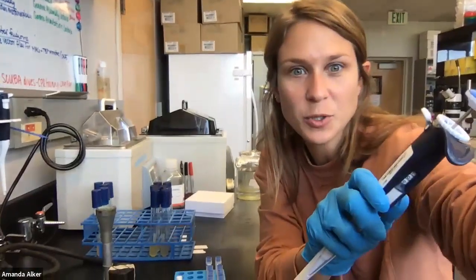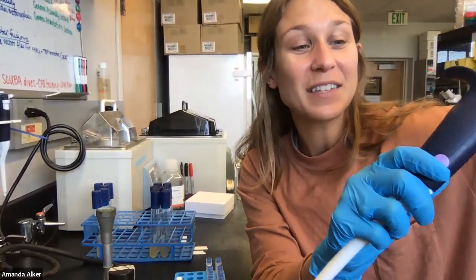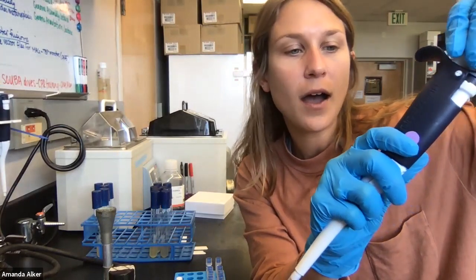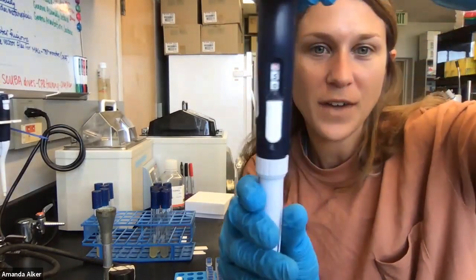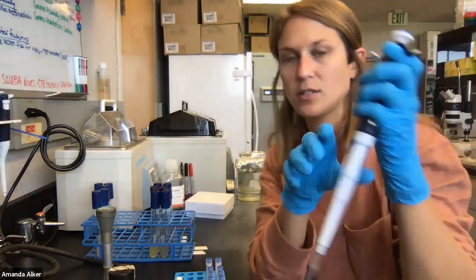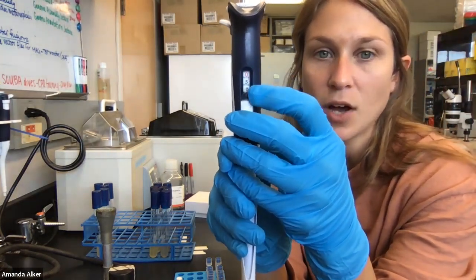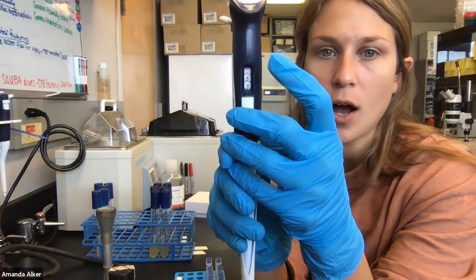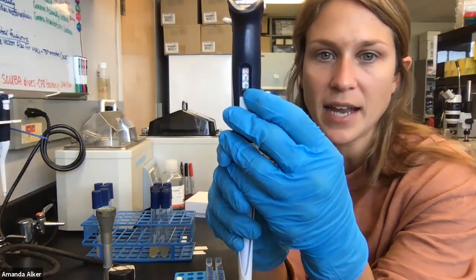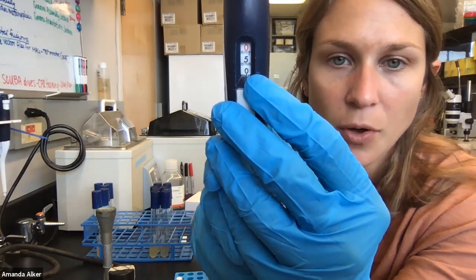Actually, it's 500 — we're doing 500 microliters of the glycerol and 500 microliters of the culture. So let's think about this: this goes by your highest denominators. This is your 1000s, this is your 100s, and this is your tens. And then anything in between the tens, there are little baby tick marks — those would be your ones.